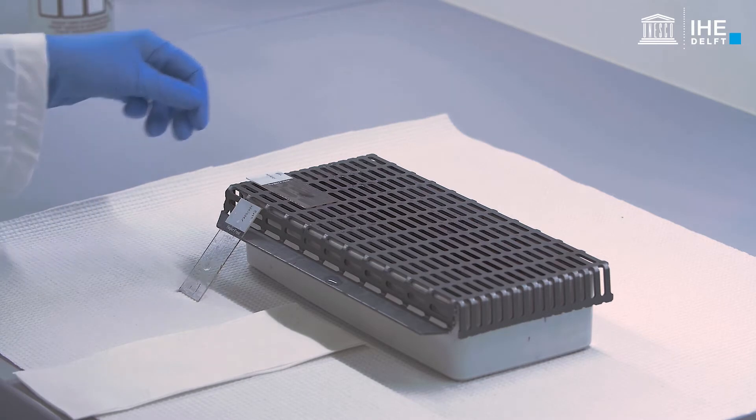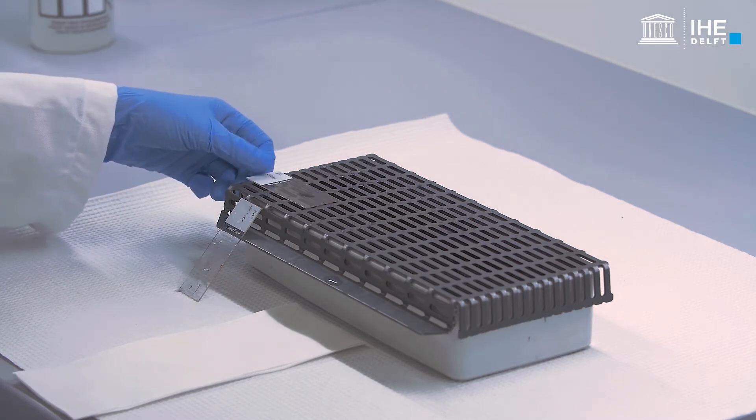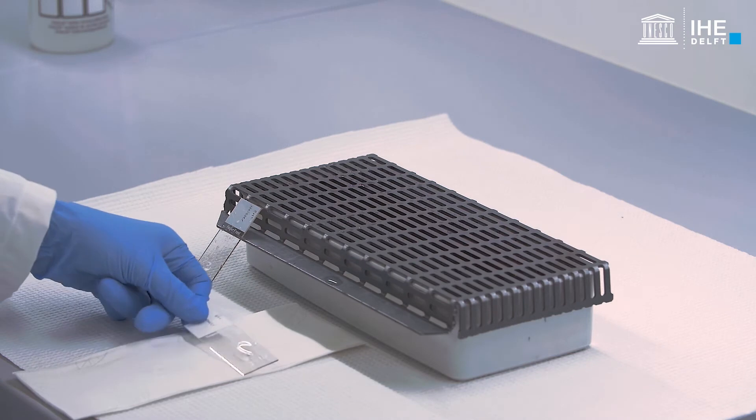Leave the slide to air dry or carefully blot excess water with a filter paper or paper towel.